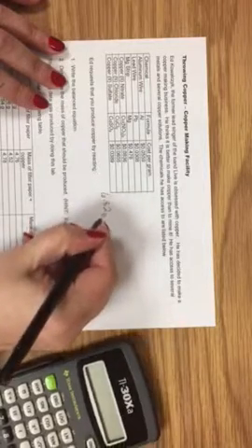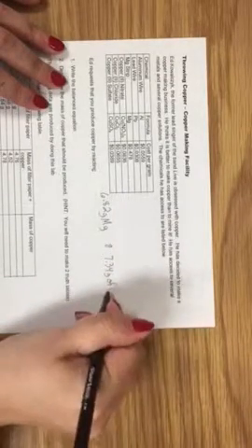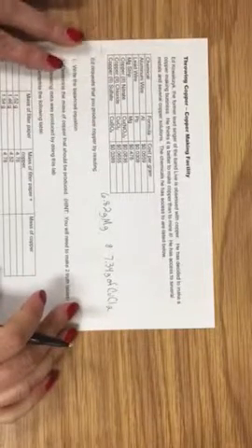Now, Ed wants me to make copper different than how you guys are going to make copper. He wants me to use 6.82 grams of magnesium and 7.34 grams of copper chloride. Okay, so that's what I have to do.